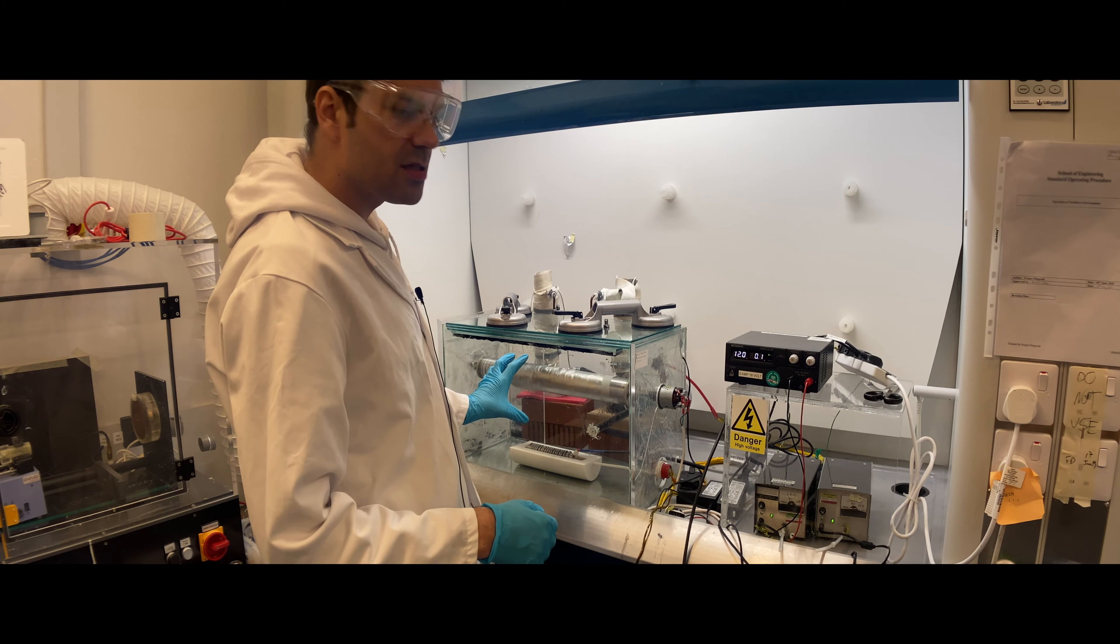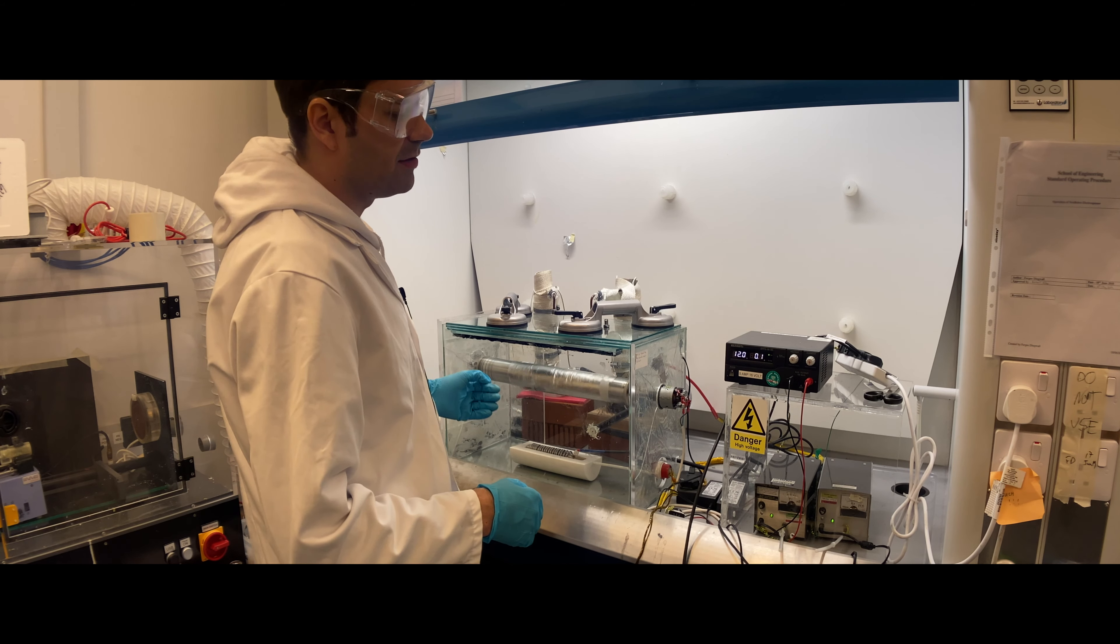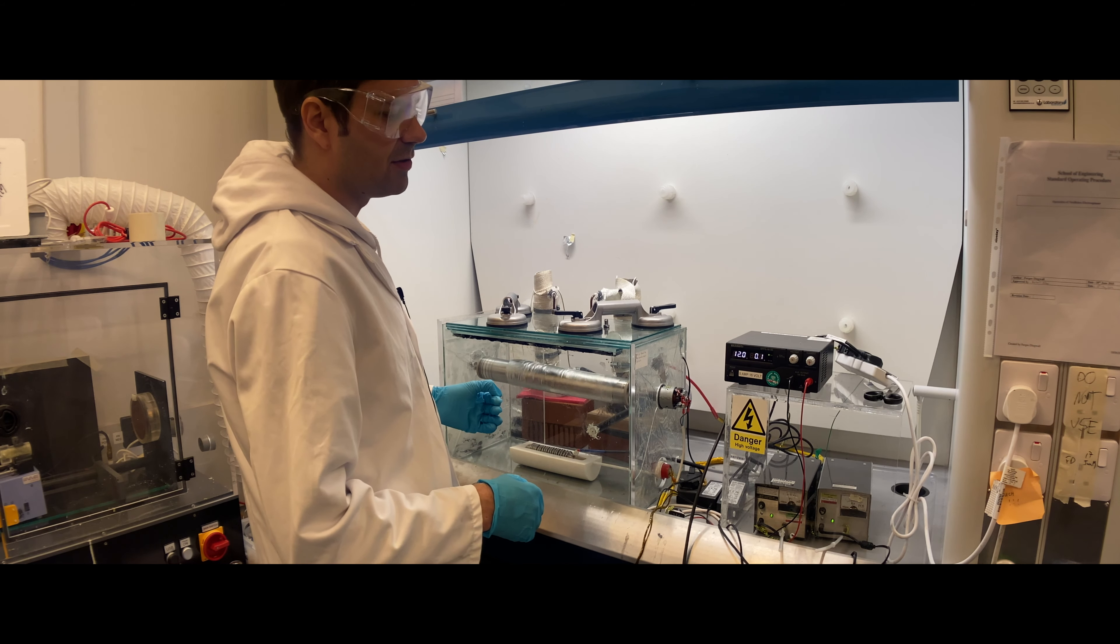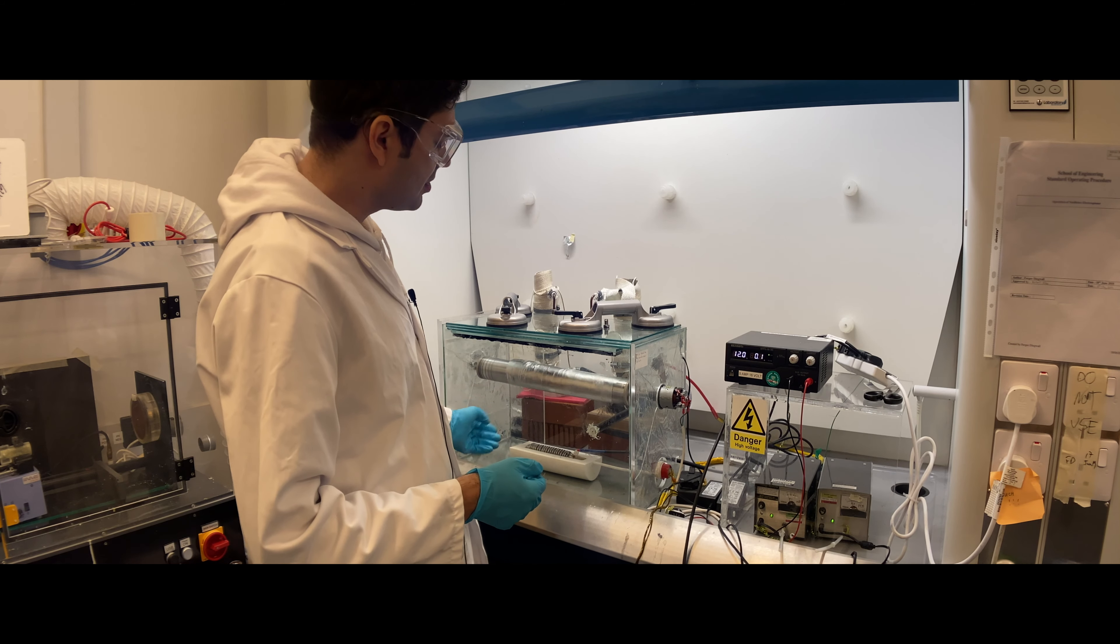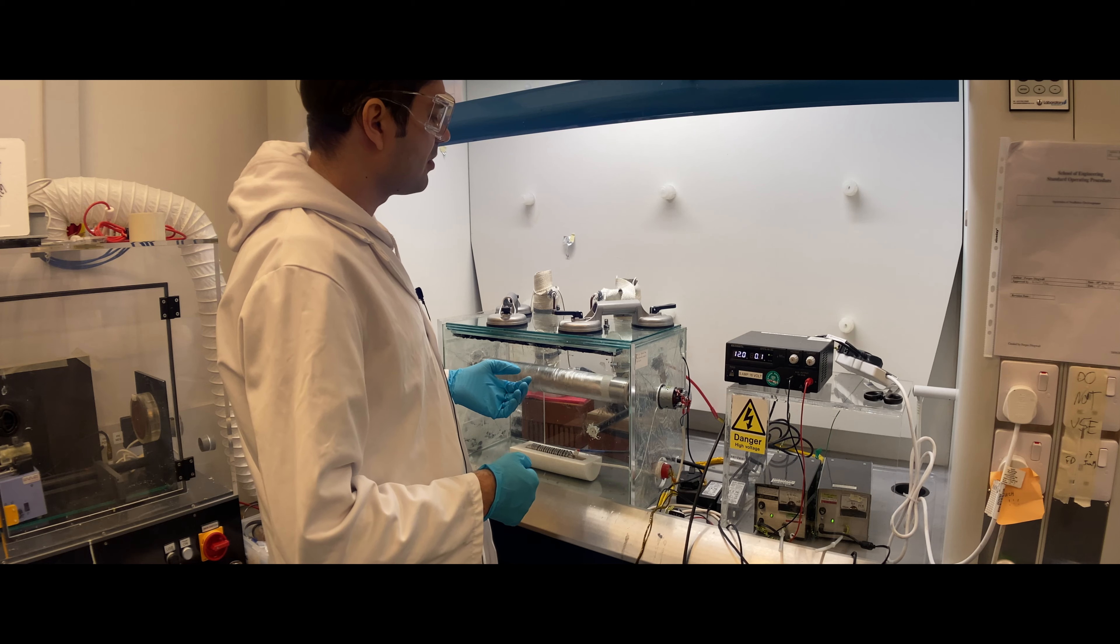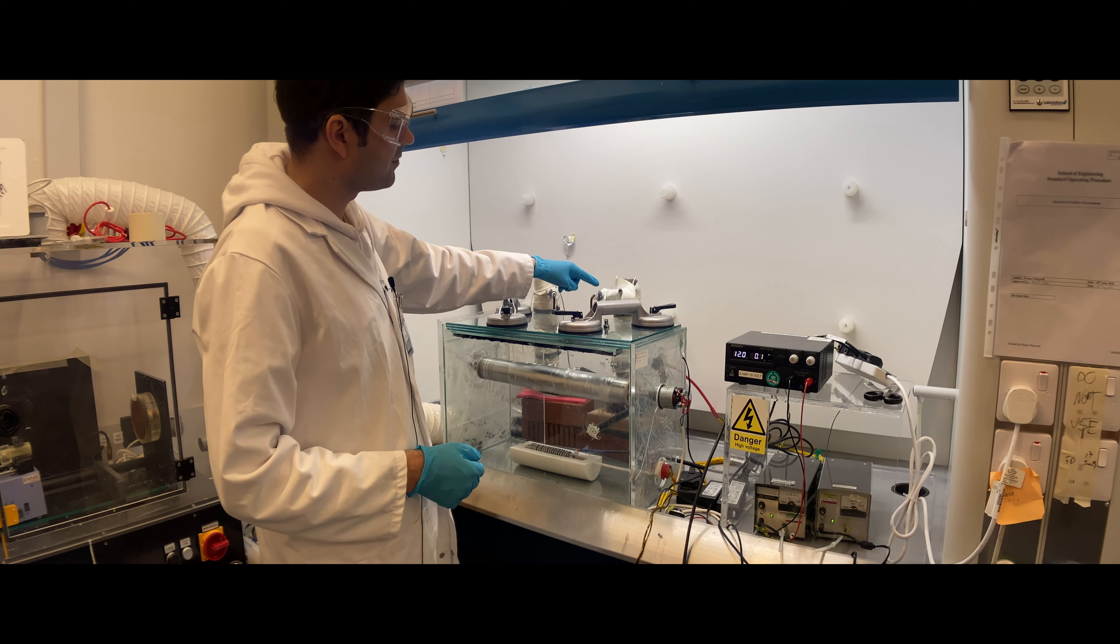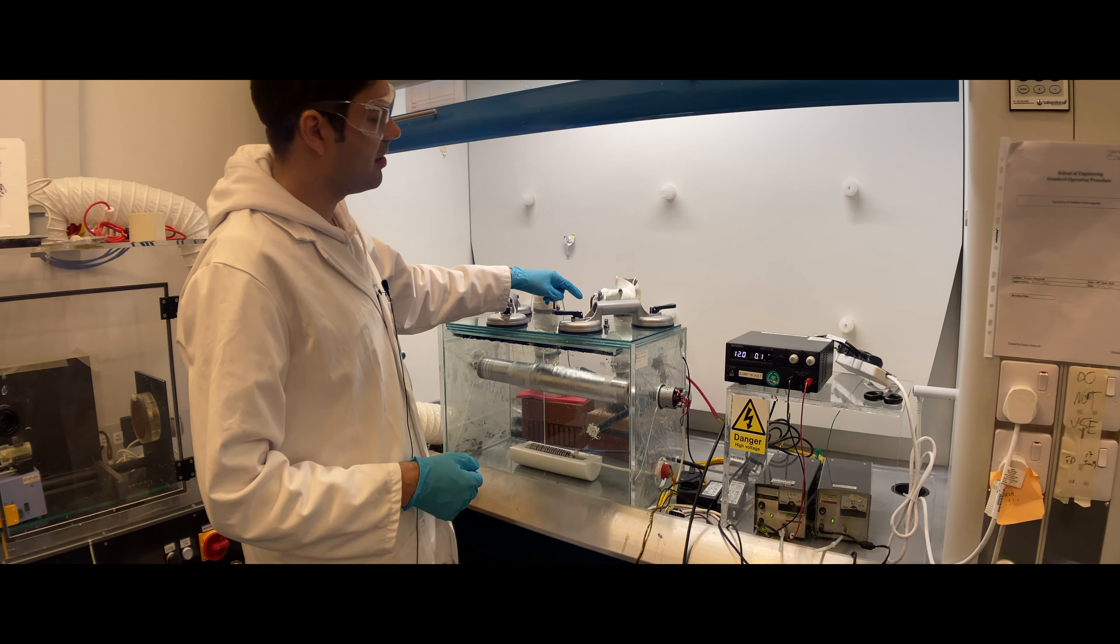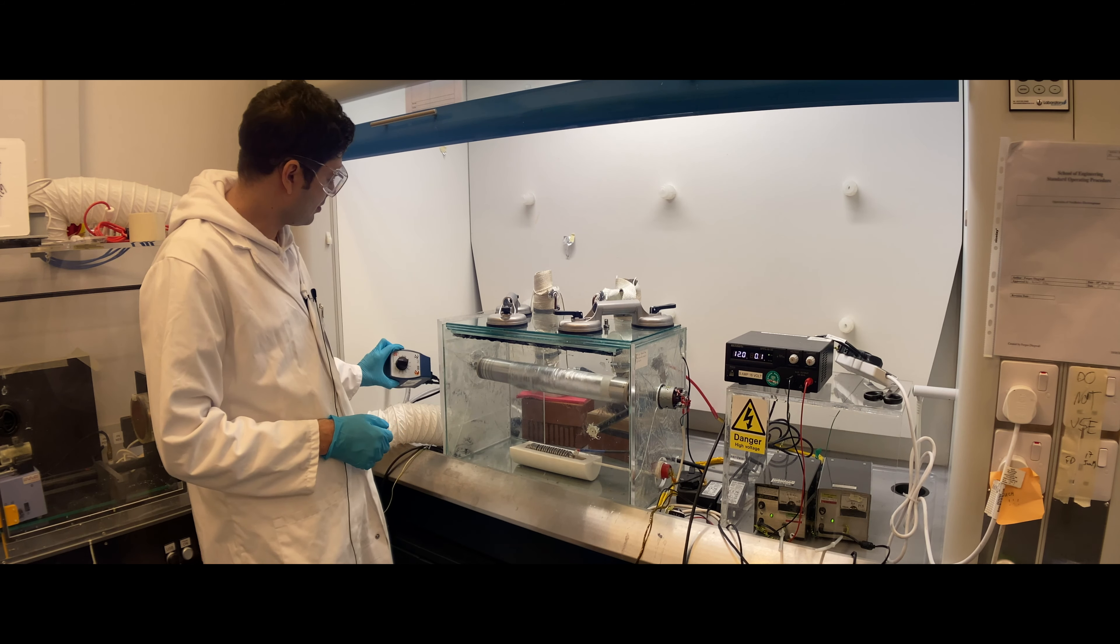Now we have 30 kV—it might be enough for some polymer systems, but for some you might need to go to 50 or even 60 or 70 kV. Very slowly adjust and wait a few seconds to see if the electrospinning has started. Sometimes electrospinning also works better if the humidity is low and the temperature is high, so you can flow nitrogen or dry air, and you can also adjust the temperature by this on the left.